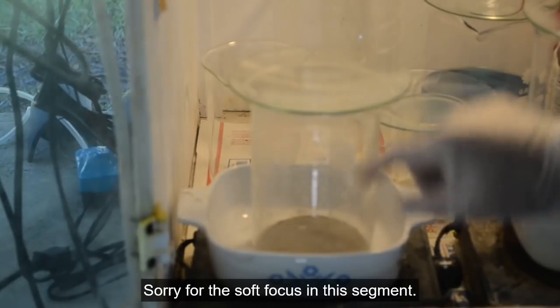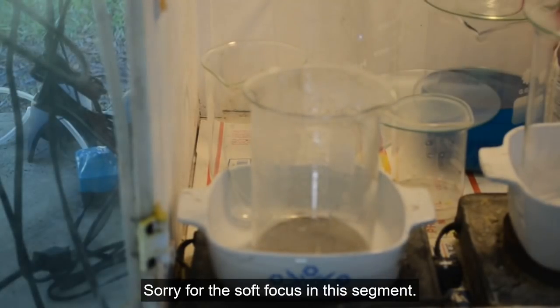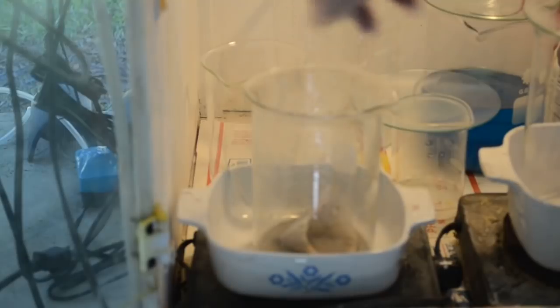I've combined the gold from the 2 drops into here. This has got a lot of silver chloride in it still. This is the filter that I used for filtering the rinse water. So that's going in there.